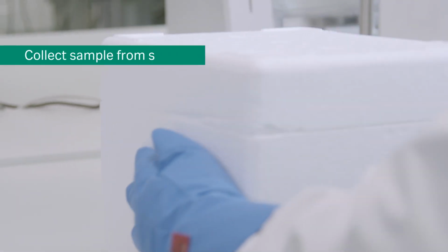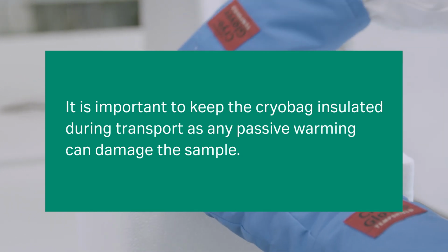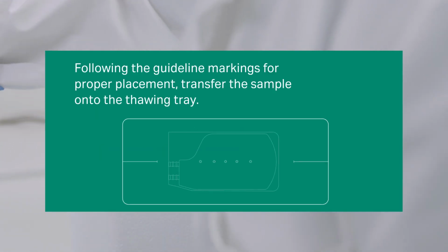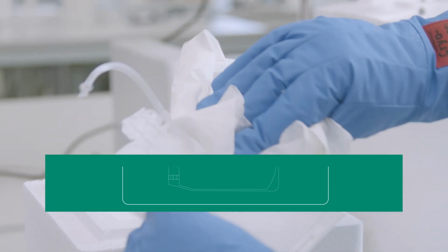Next, collect the sample from storage. It's important to keep the cryobag insulated during transport from storage to the thawing setting, as any passive warming can damage the sample. Following the guideline markings for proper placement, transfer the sample onto the thawing tray.